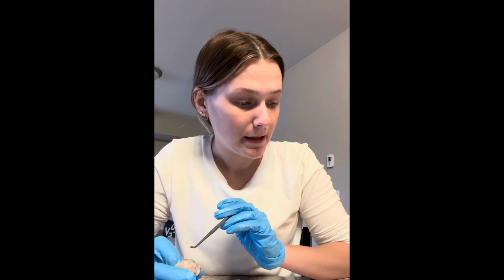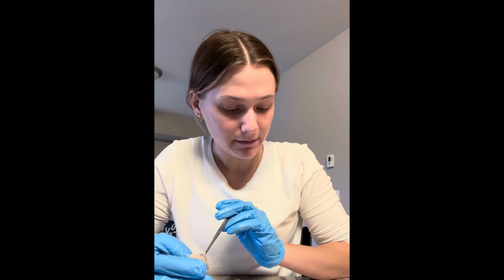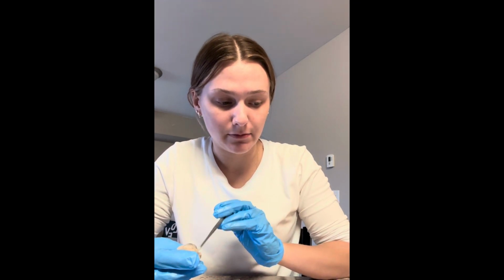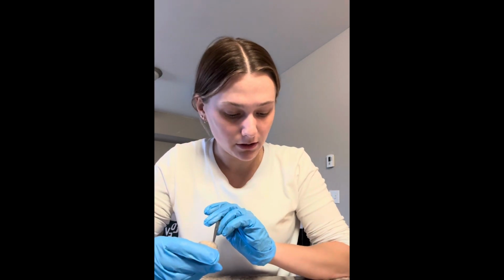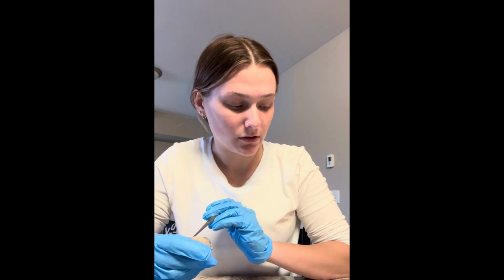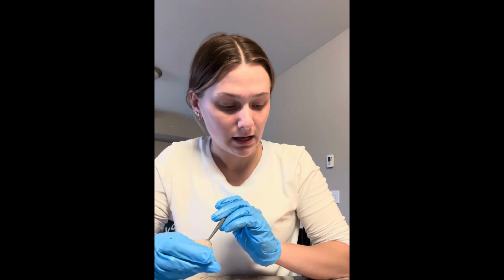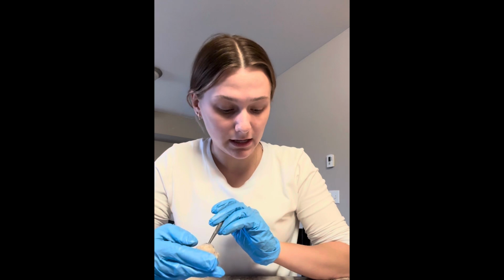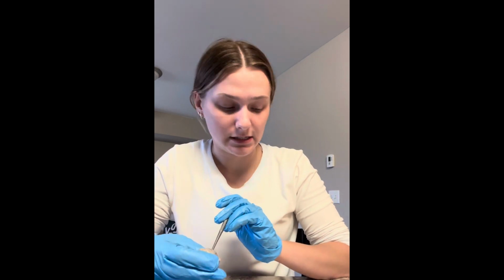And then lastly, I'm going to talk about the retina. And the retina lies between the sclera and the vitreous humor. And the retina is a light-sensitive portion of the eye composed of receptor cells called cones and rods. And we talked a lot about cones and rods this unit, and that cones are responsible for perceiving color, and rods are responsible for perceiving light in different intensity.